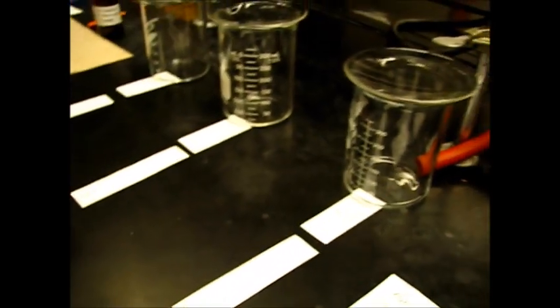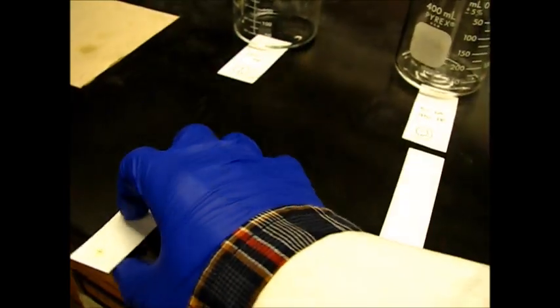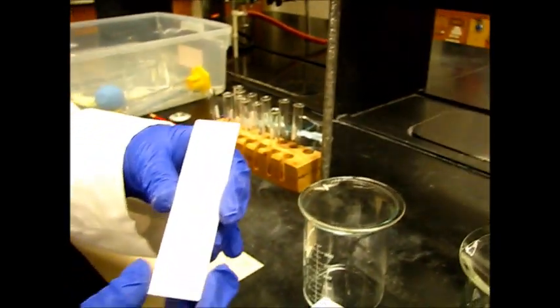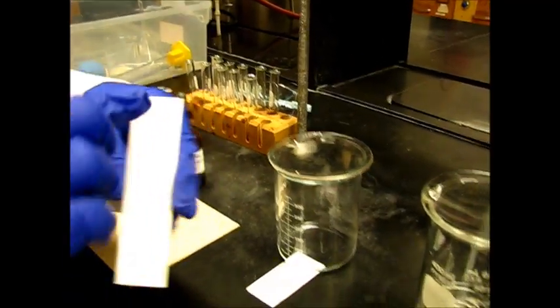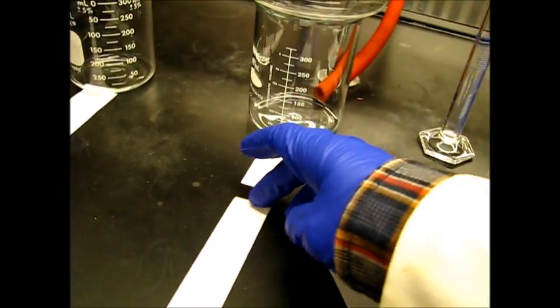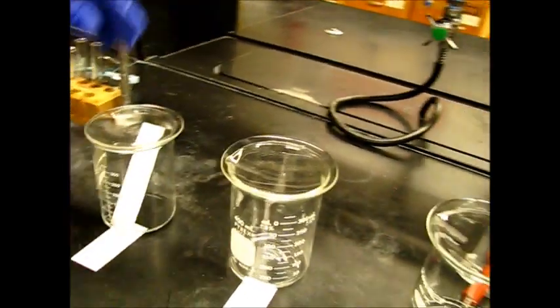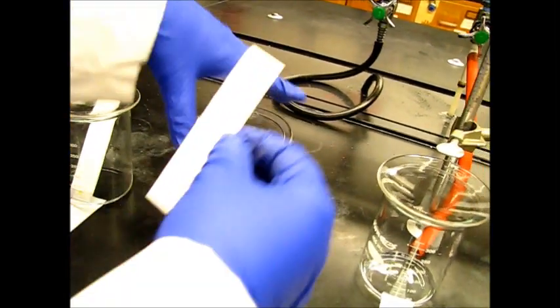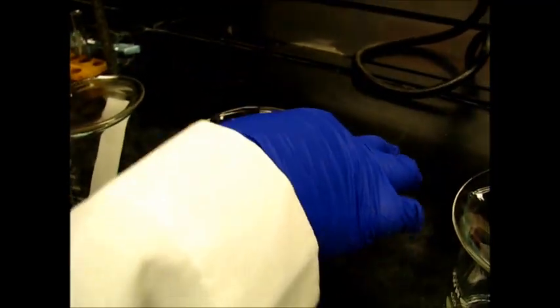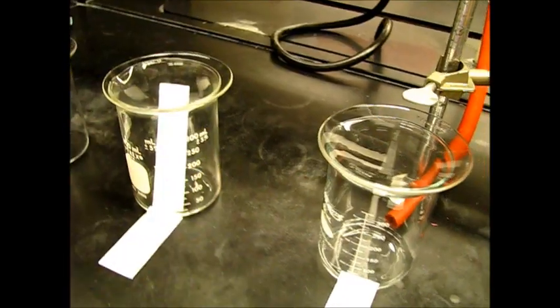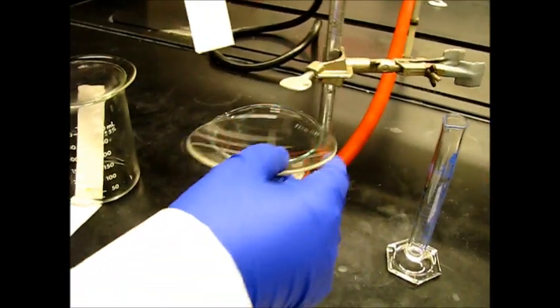We're going to let it air dry for 30 seconds before we put it in our TLC chamber. Ethyl acetate is easy to remove, and you can air dry like this or you can just use your hand to dry it. Make sure that whenever you're taking your TLC plate, take it from the sides. Do not put your hands on top of it, just on the sides. And then now that they're all dry, we're going to put them in the chambers. Make sure that you're immediately putting them inside. You have to place it very slowly, very gently.